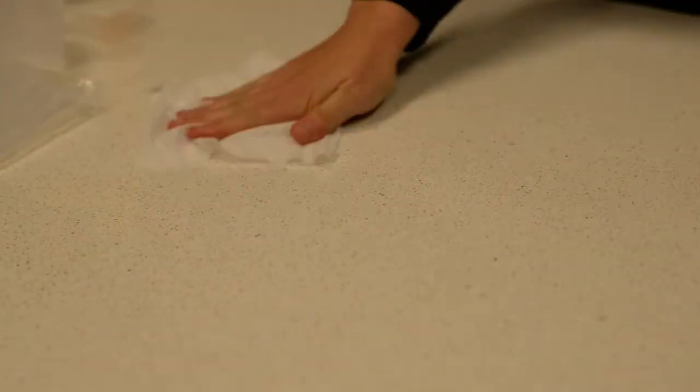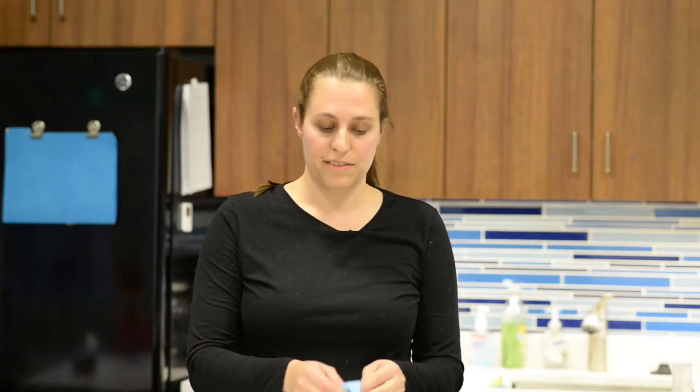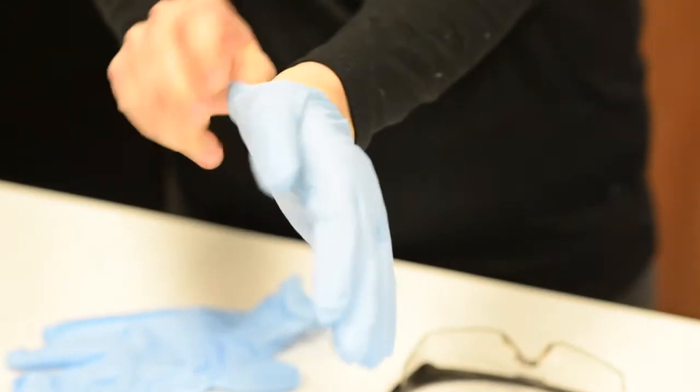So first we'll make sure we have the safety rules covered. First we'll wipe down our work area. If you have long hair you should tie it back. Next you'll put on your safety gloves and safety glasses.